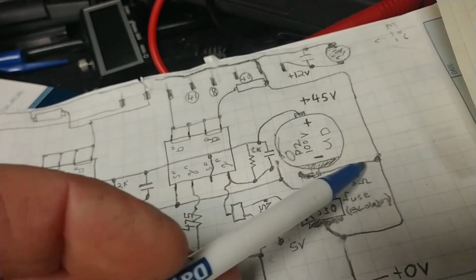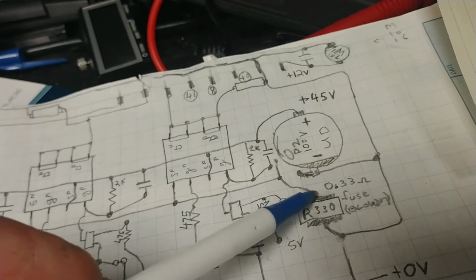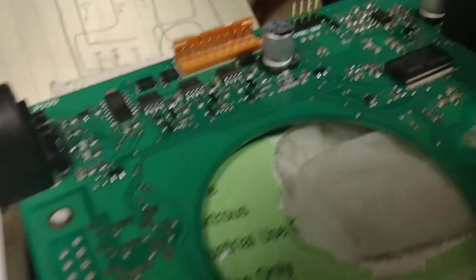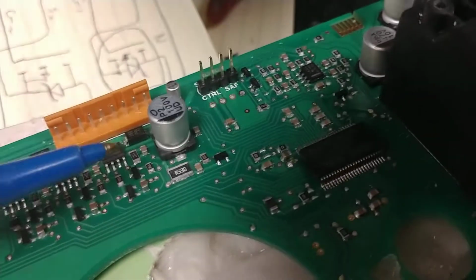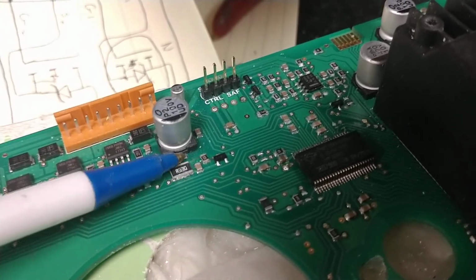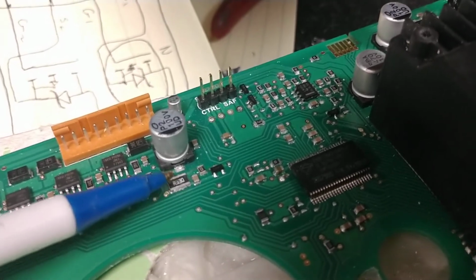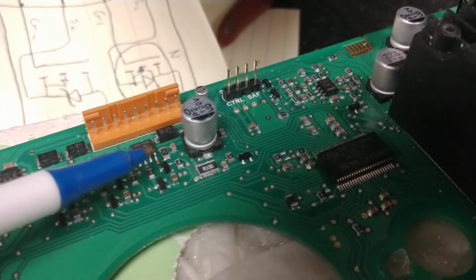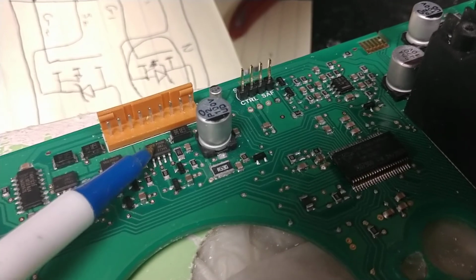The circuitry had it winding to the bottom and then back up. At first it didn't seem logical. Why wouldn't that just be connected directly on the actual circuit board? Why wouldn't they take that capacitor and connect it directly to that side instead of looping around? Well, they did that because it makes this closer to then go out to each of the 3 power MOSFET drivers. Each one of these is a double MOSFET, a P-type and an N-type.